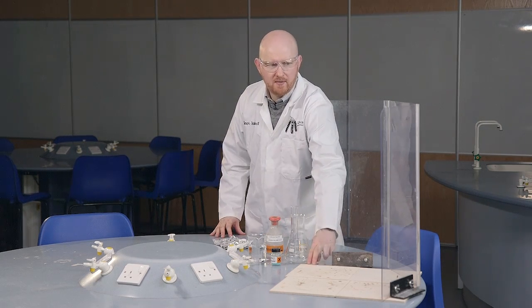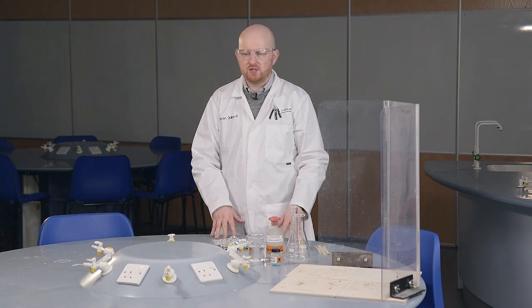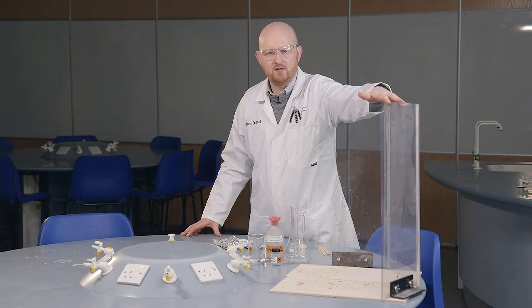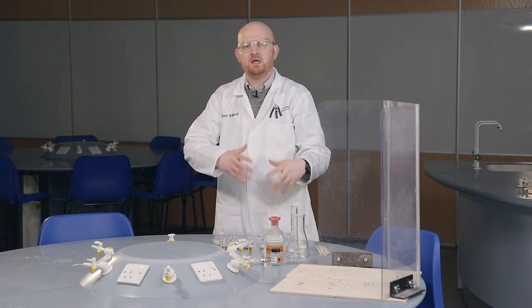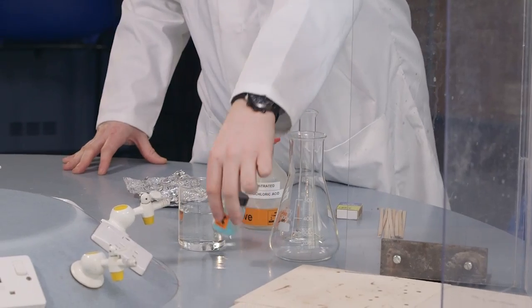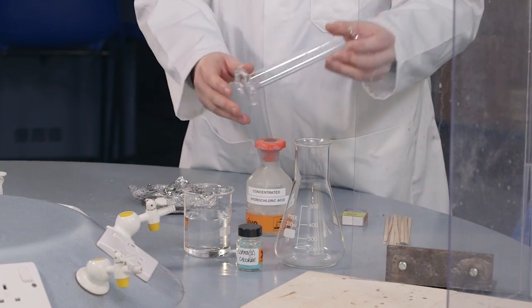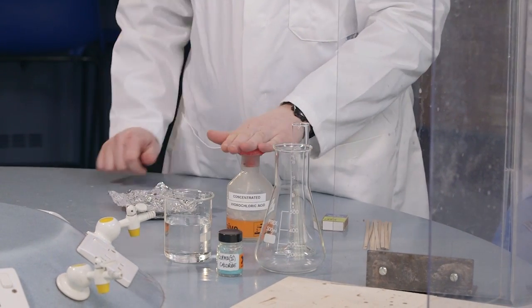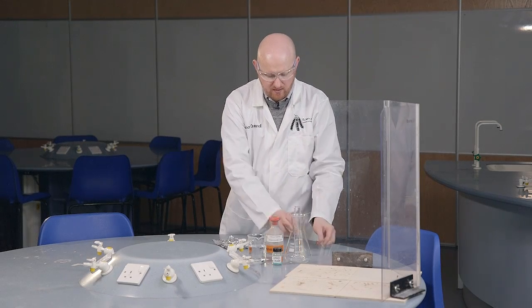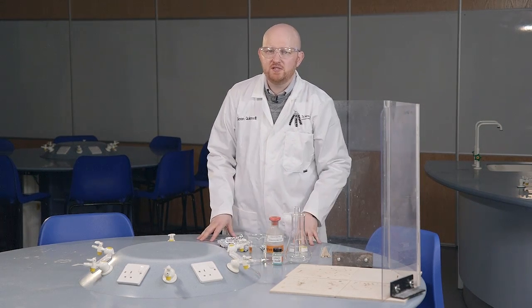Looking at our Northern Lights demo, we have heat-proof mats and a safety screen. If you're doing this to an audience, they need to be about 3 metres away, and you need a safety screen on each side — one for you as the presenter and one between the demonstration and the audience. We also have a conical flask, around 6 grams of copper 2 chloride, 200 mils of water, a measuring cylinder, concentrated hydrochloric acid, some splints and matches to ignite the Northern Lights, and some aluminium foil.